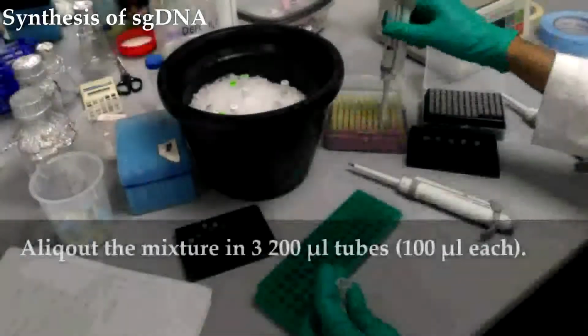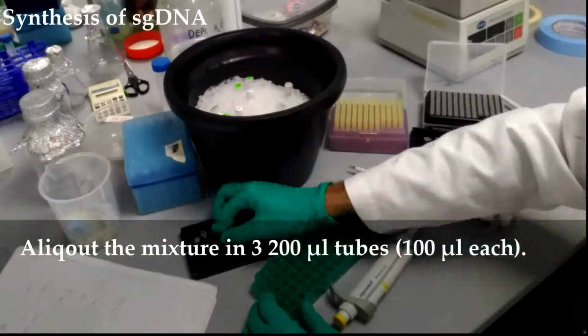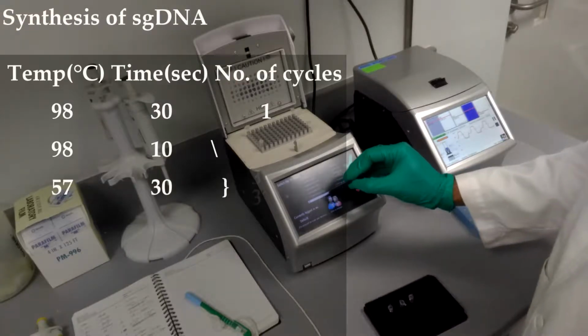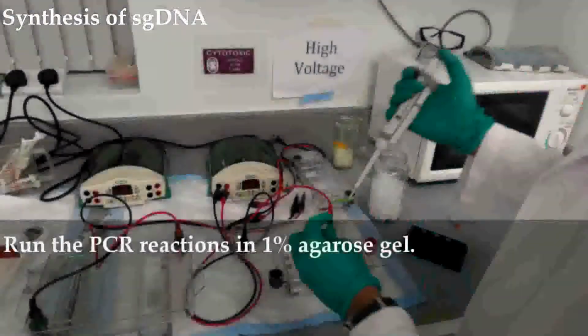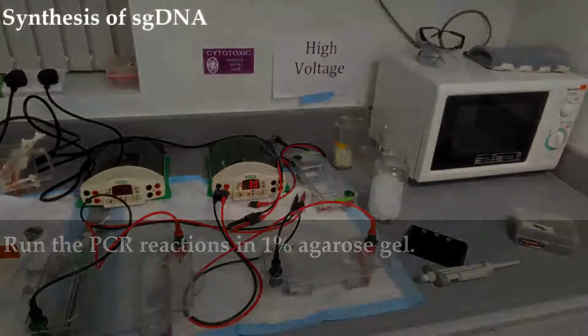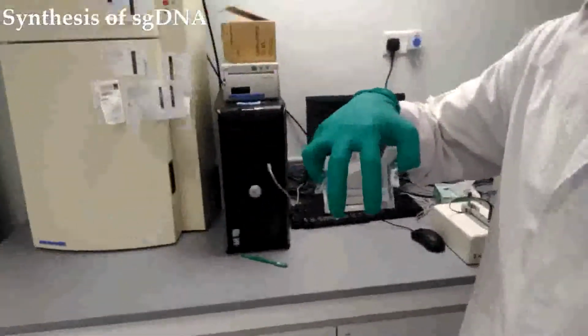Vortex the mixture and aliquot in 3 200 microliter tubes. Set up PCR reaction with settings as shown on the screen. Run the PCR reactions in 1% agarose gel. Image the gel using a gel doc system.